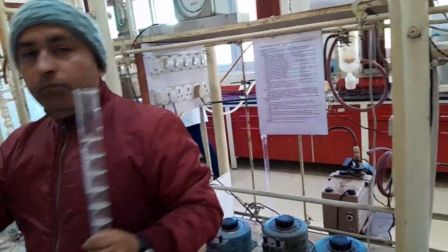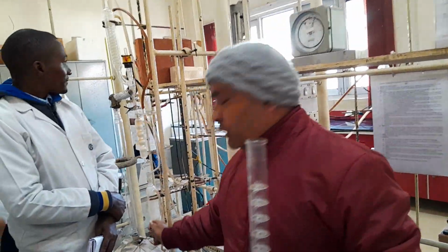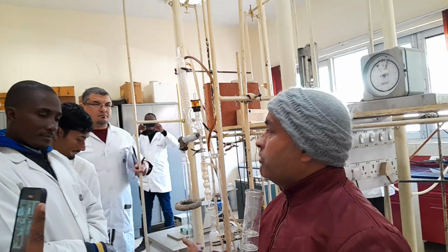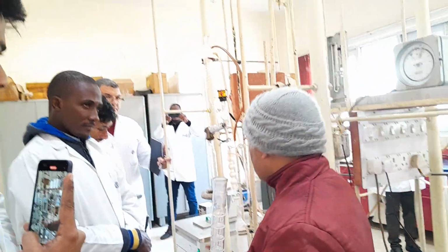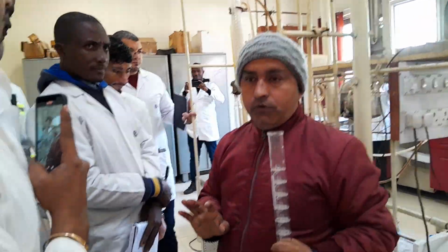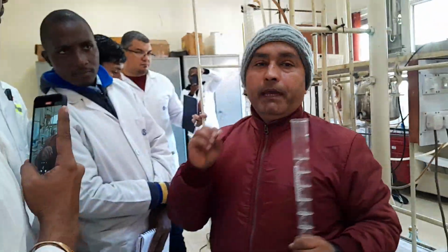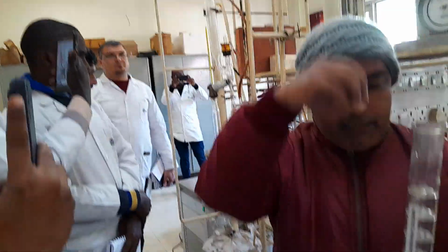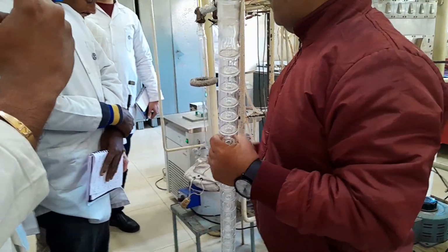Now, starting the distillation. Because this is a manual unit, once you have heated up, crude oil is not that intelligent, only lighter vapor will come first. Along with that, other hydrocarbons will also come out. Now my duty is to let the vapor reach up to the condensation area. The vapor reaching the condensation area, after condensation, the whole liquid goes back into the column for the interaction with the vapor.